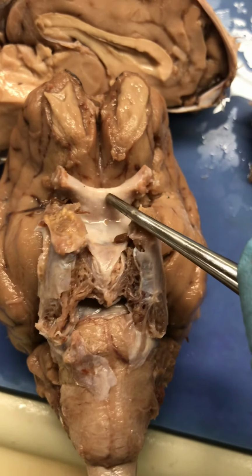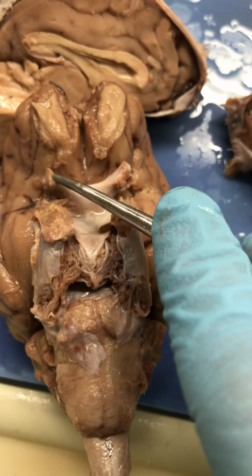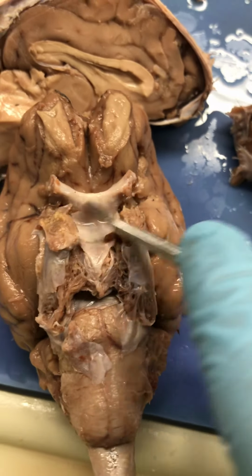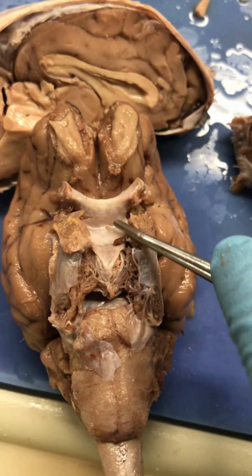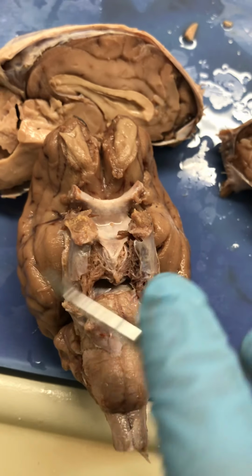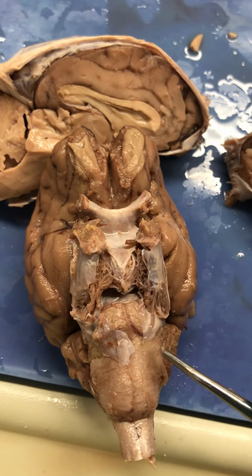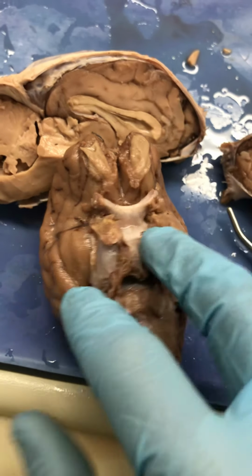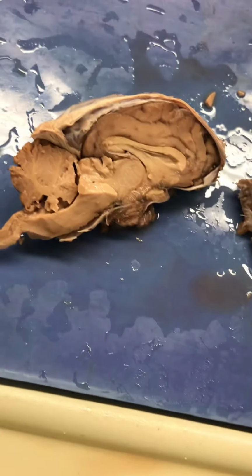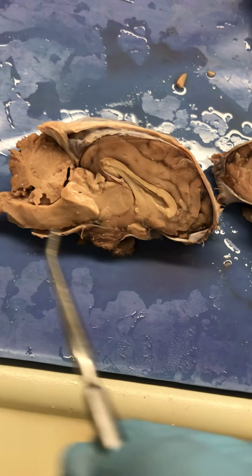That's the optic chiasm where a lot of the optic nerves cross over. There's about 1 million neurons in each of the optic nerves, and about half cross over and go to the opposite side of the brain, and then the other half stay ipsilateral. That half crossing over and half staying the same gives us stereo vision. Okay, so I hope you guys are good with the pons.